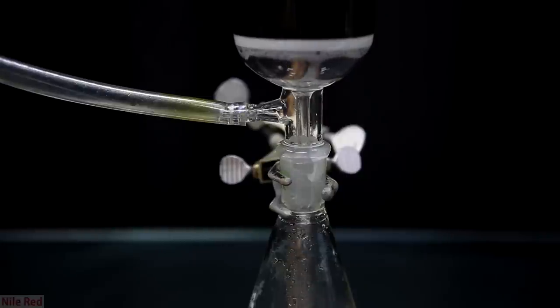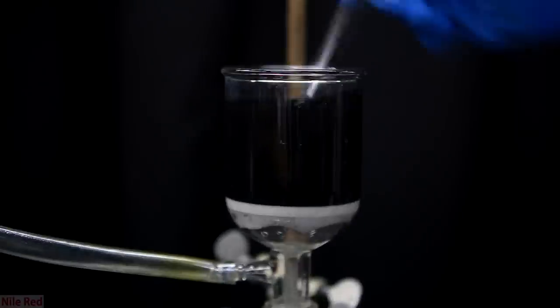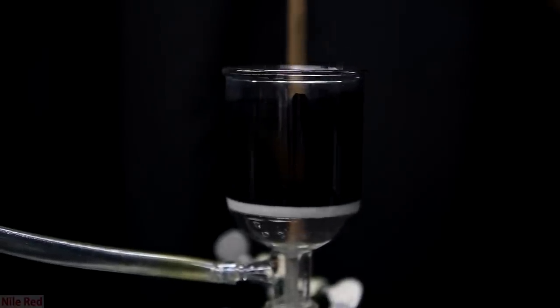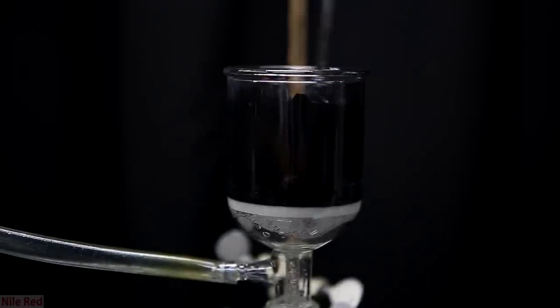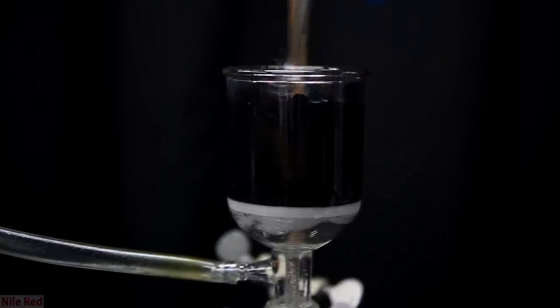You don't need to vacuum filter it though, you could in theory just pour it into a large tray and let it air dry. I was a little bit pressed for time though because I wanted to do the bromine synthesis the following day, so this was at night and I wanted to get it done before I went to sleep.